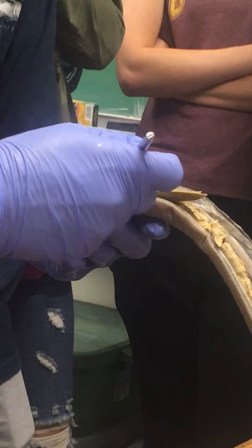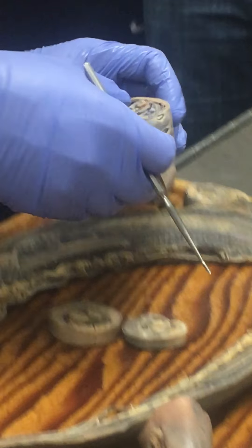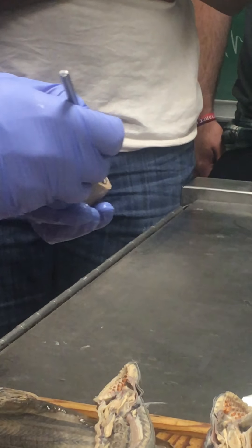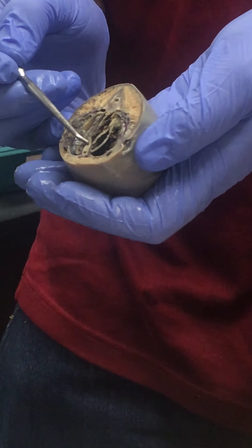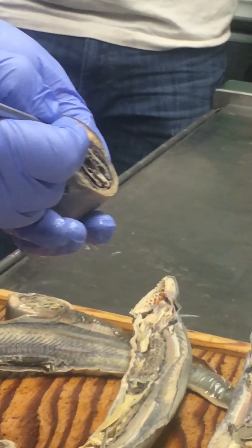The ventricle gives rise to a blood vessel that runs forward under the whole gill region — that's called the ventral aorta. You can see it right there in a cross section through the gills; it's carrying blood from the heart to the gills. That blood is not oxygenated because it's just come back from the body. It goes to the gills, gets oxygenated, and then gets distributed to the whole body via the dorsal aorta, which is up in the dorsal region right below the notochord.